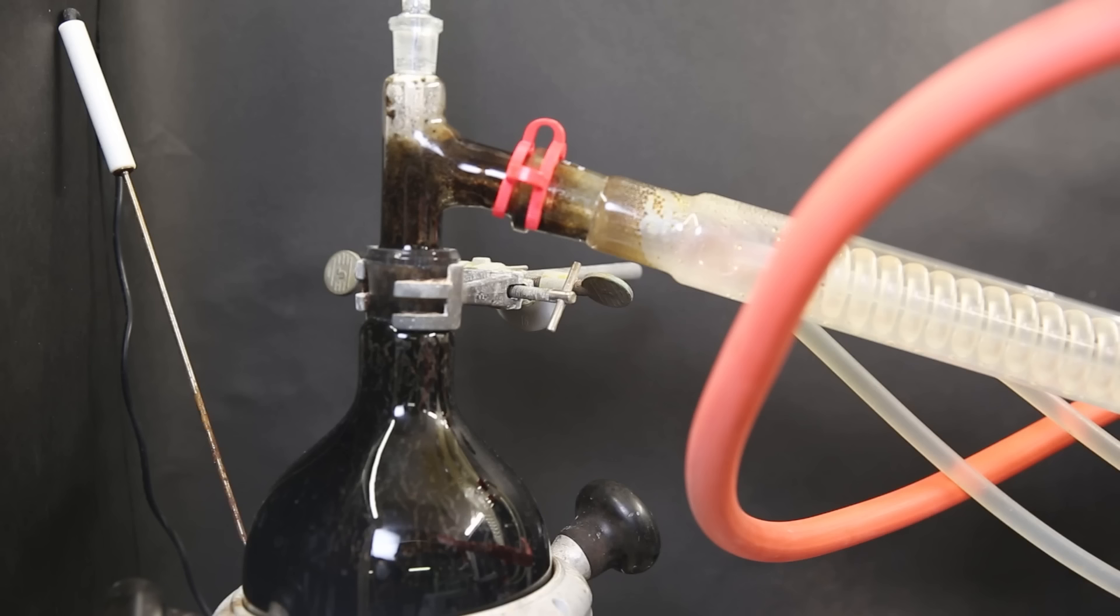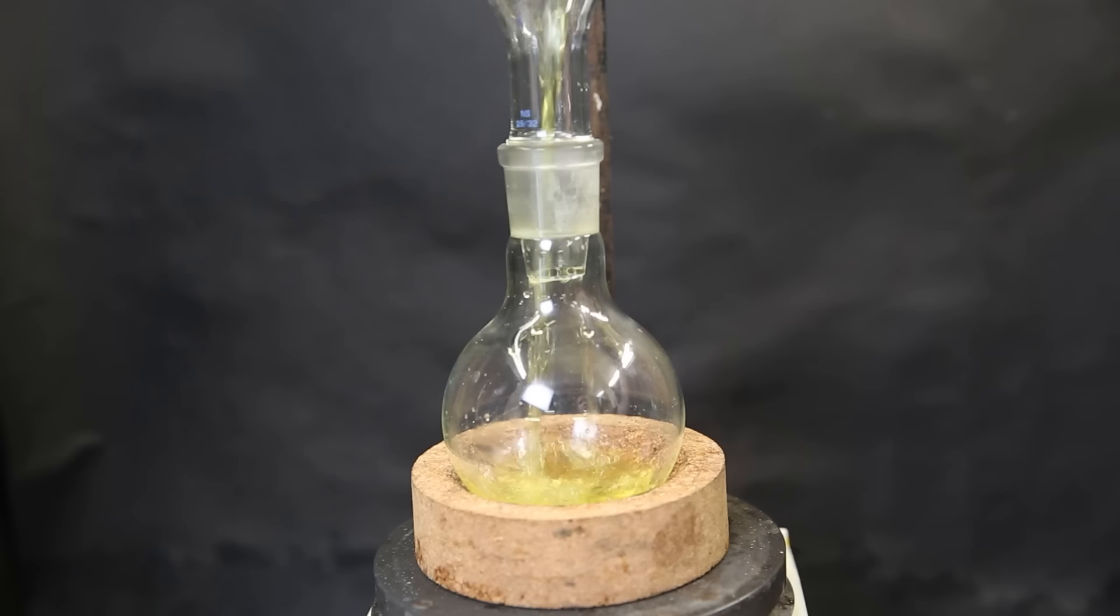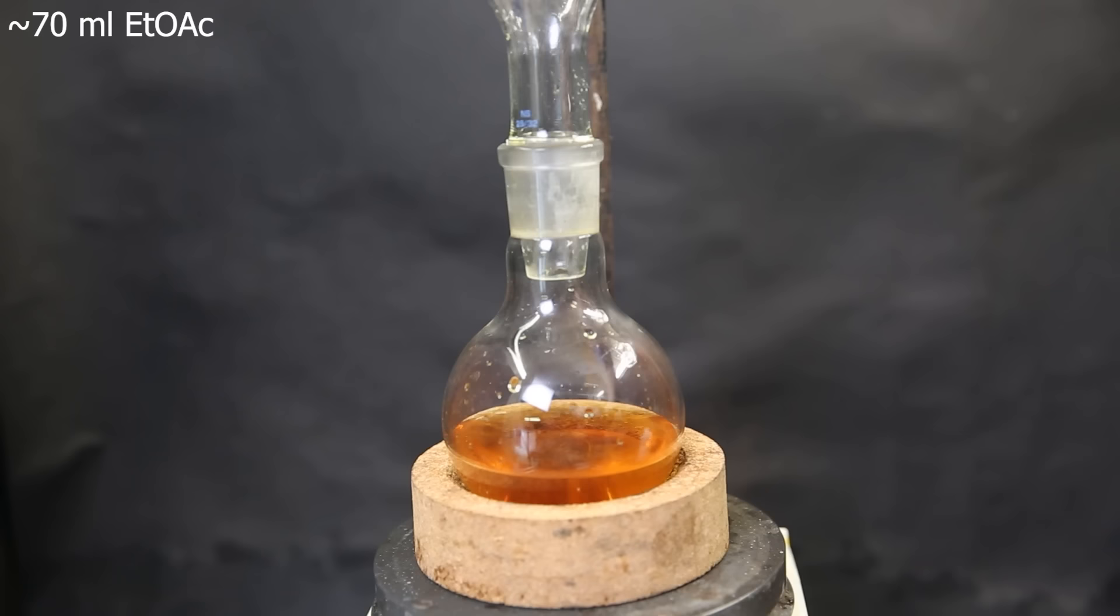When it is done, the whole flask and the distillation head are covered in black tar. I ran the reaction another time and combined both distillates, which are slightly different in color.